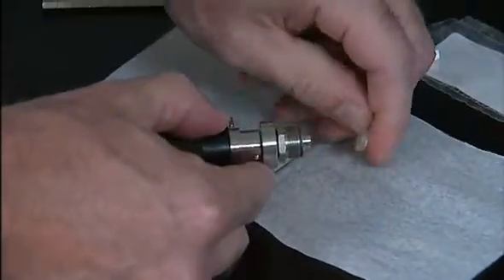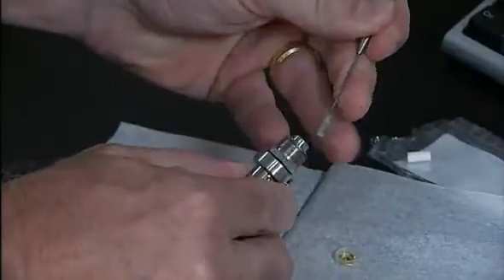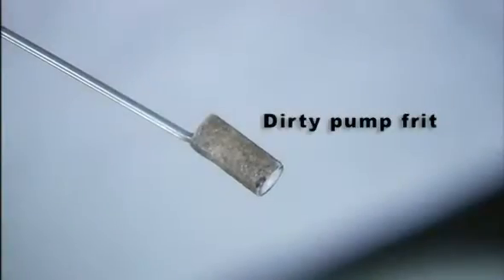Your pump seals are yet another source of particulate generation. As your pump is used month in and month out, eventually you have to replace your seals. Also, during the process of seal wear, very small fragments of graphite-filled Teflon, or whatever seal material your pump happens to use, could find its way through your flow lines, your tubing, your pulse dampener, etc., and lodge in your column inlet frit.